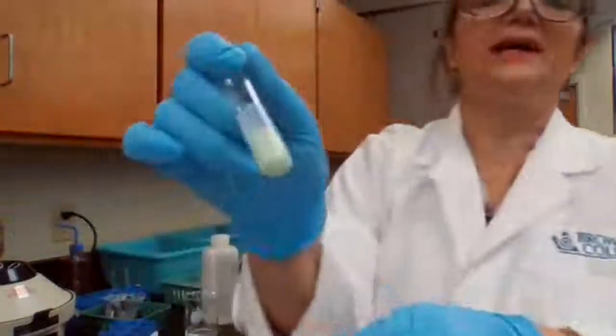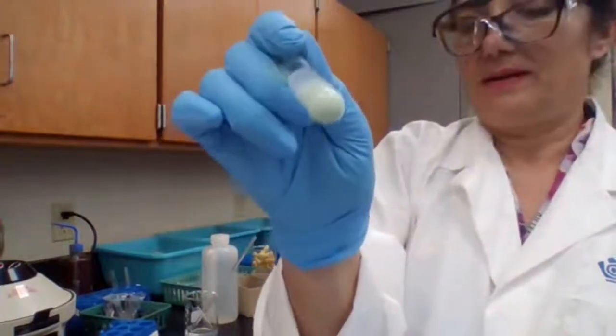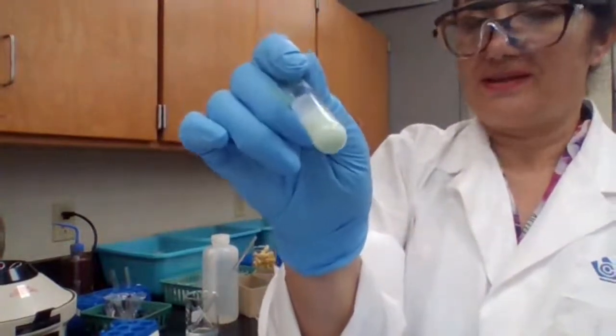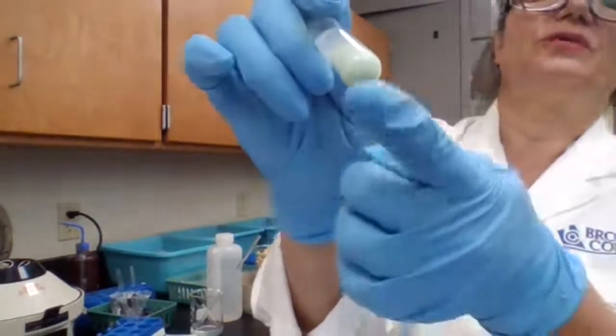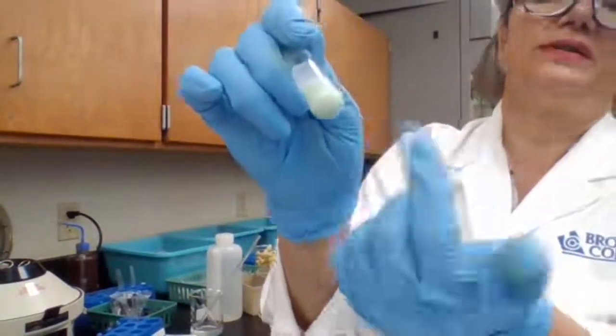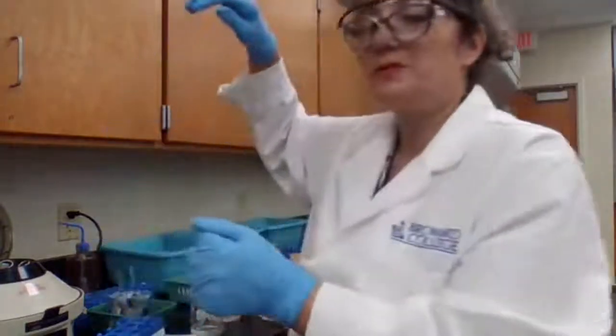It did settle down and I see the black particles. That's how I can omit the centrifuge. Otherwise, I have to centrifuge it in order to see it. But since I already see it, I don't have to centrifuge. Okay, I'm done with the bismuth part. The only thing I need to confirm at this point is copper, to make sure that I have the copper confirmed.